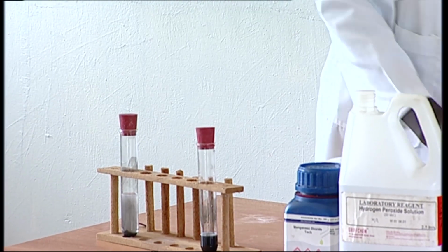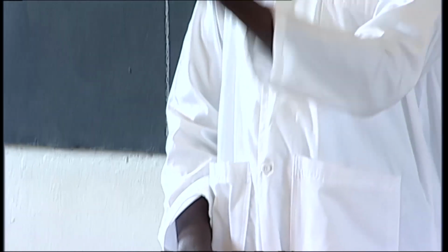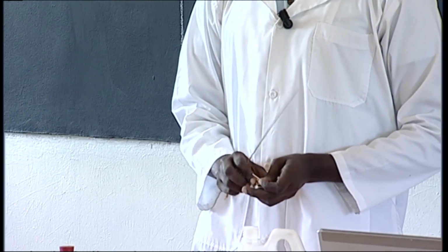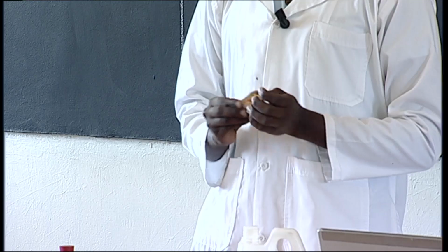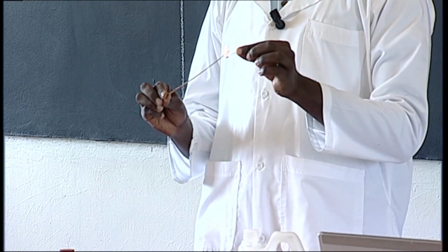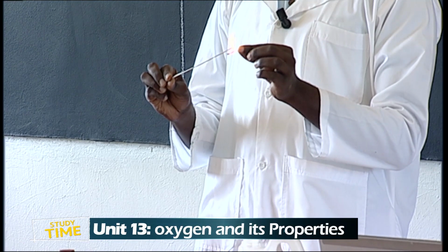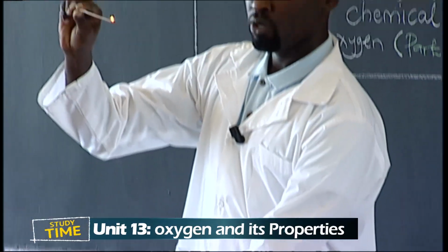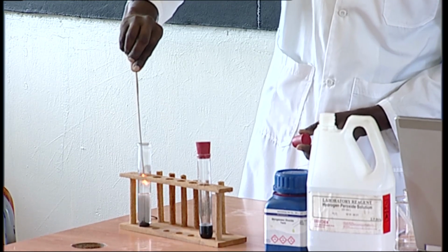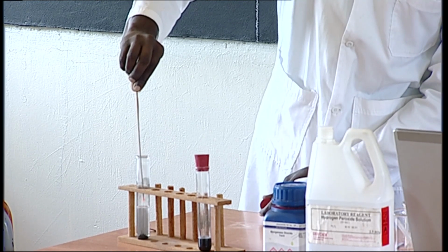Now, let's bring in our glowing splint. As I said, this is a splint, which is basically a wooden material. It becomes glowing when we light it up. So I'm going to use a matchbox to light up our glowing splint. All we need is to have it lighting up. Now, this is the glowing splint. To test, we need to see what will happen. You see what is happening?